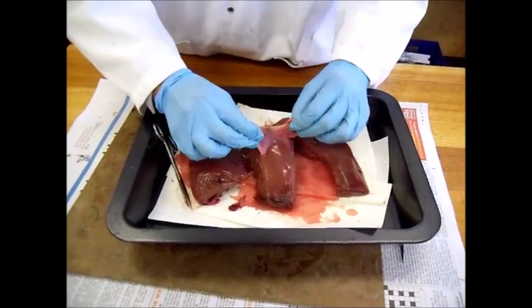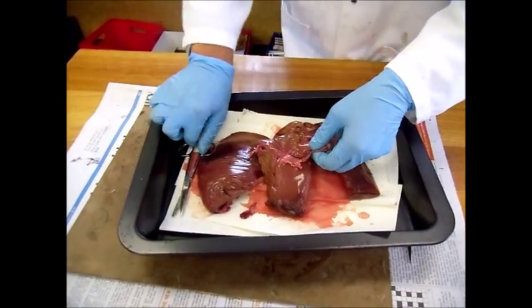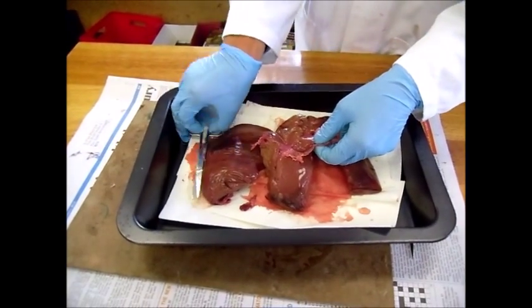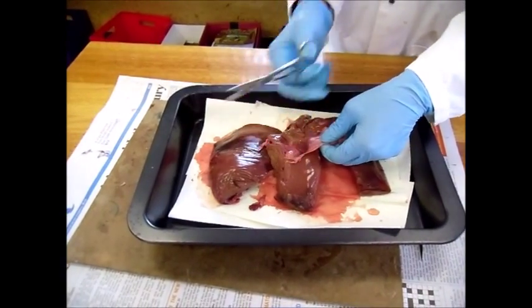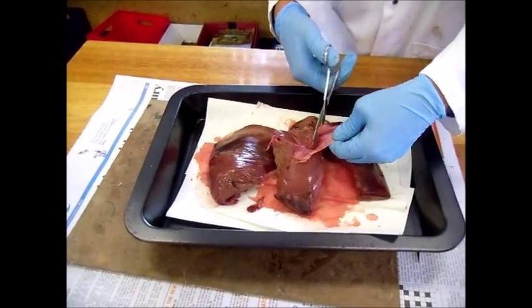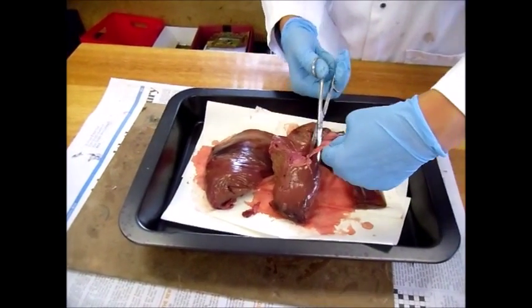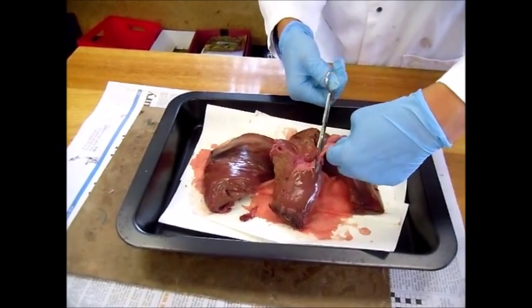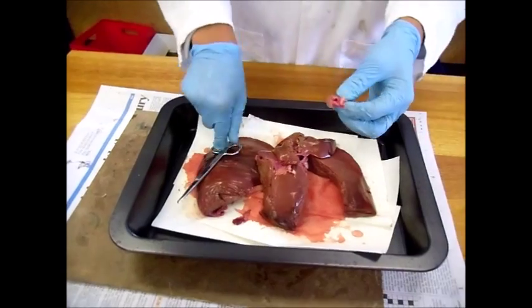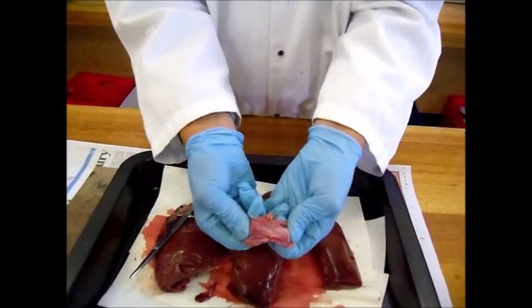Some membrane can be found attached to the liver as you can see here. It is quite difficult to cut this membrane off. It is quite tough to hold the liver in place with the rest of the body.